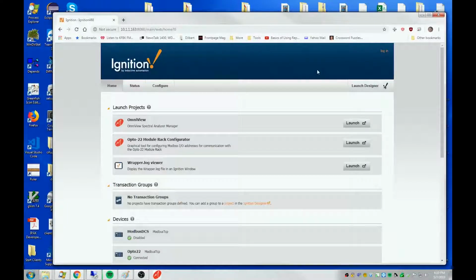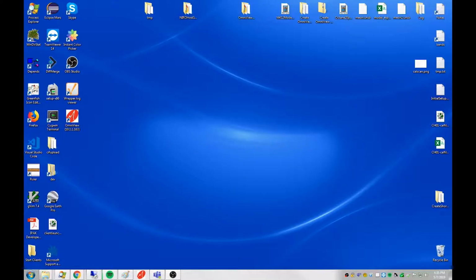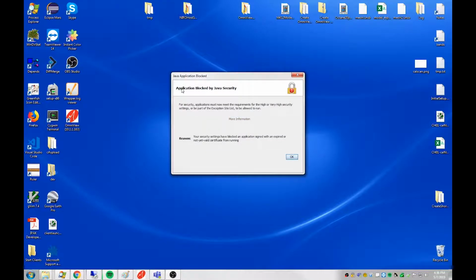Those are the various methods for starting an OmniView client, both on the server machine inside the cabinet and on a remote computer connected on the same network. I failed to show you in that video what to do if you run into a Java security issue. Let's use my shortcut here I have on the taskbar to try to start OmniView. And you can see here I get a message from Java saying the application's been blocked. This will most likely happen to you, but it is fixable.